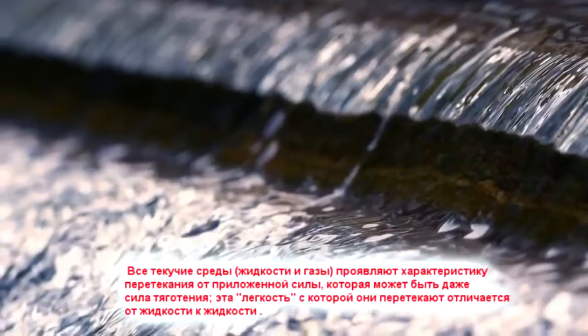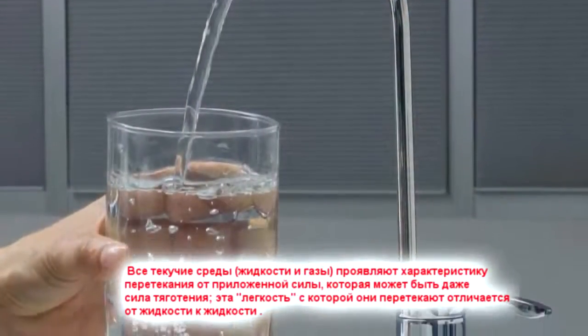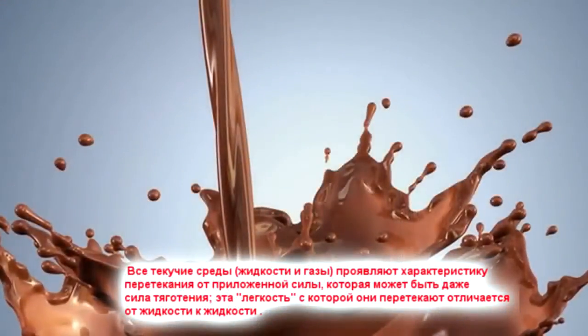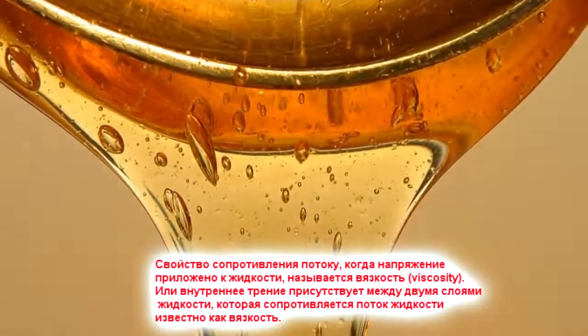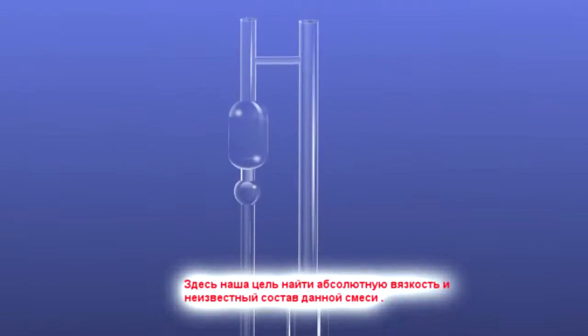Liquids and gases exhibit a characteristic property of flowing under an applied force, which could be even the force of their own weight, and the ease with which they flow differs from liquid to liquid. The property of resistance to flow when a stress is applied to a liquid is called its viscosity. Here, the aim is to find the absolute viscosity and the unknown composition of a given mixture.